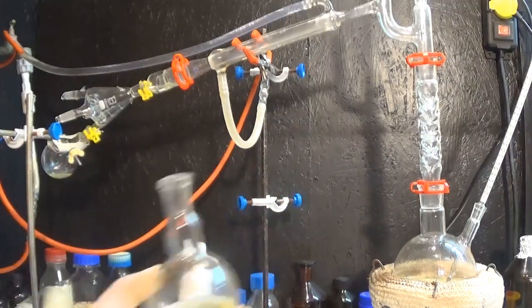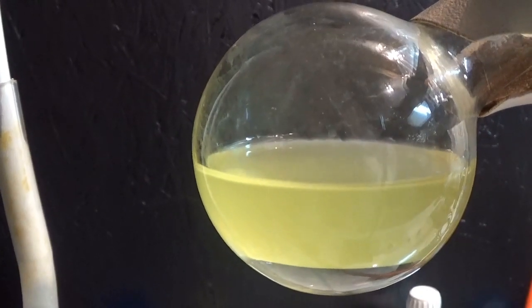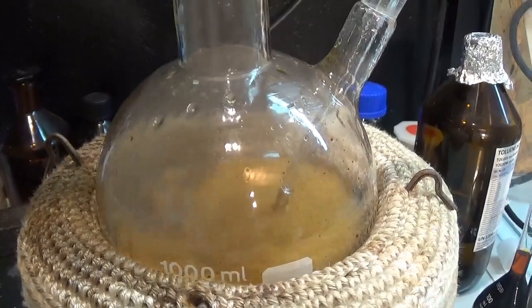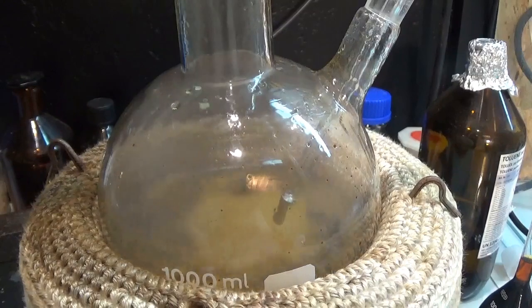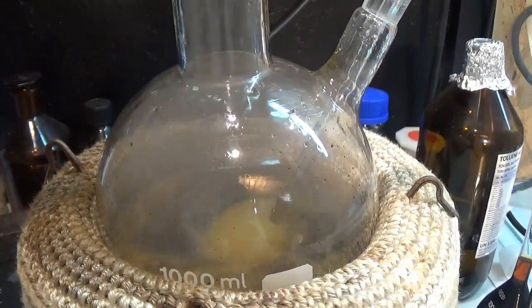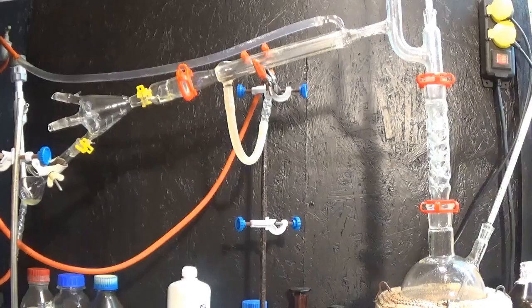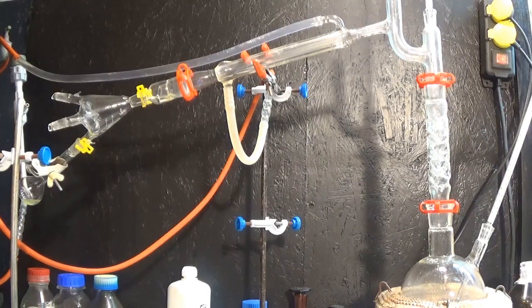The third fraction from 85 to 95 degrees Celsius has two separate phases, with the upper hydrocarbon and a lower water layer. At around 160 degrees decomposition reactions occur in the distillation flask indicating that the non-heat treated pyrolysis oil is not stable. The distillation was stopped when the decomposition occurred and the flask was swapped again to save the third fraction.